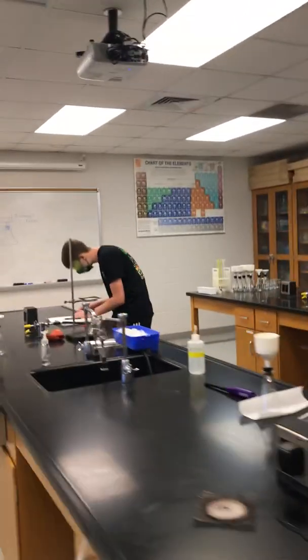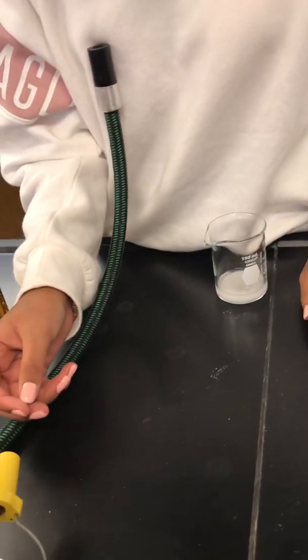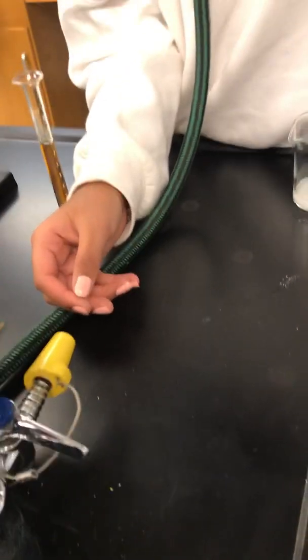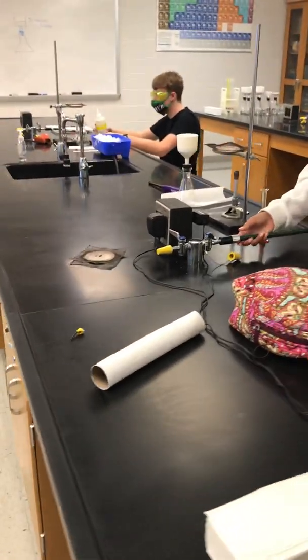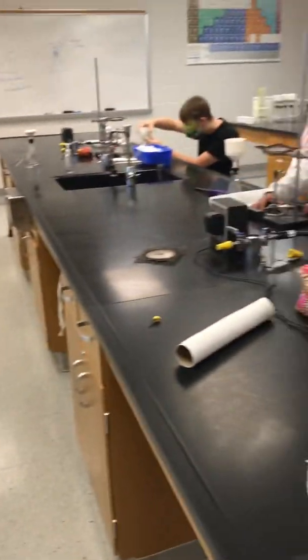All right, we've got to get that off of there. Is it this side? It doesn't matter. Remember how there's an arrow right there — slide that up into the arrow. We don't want the cool water. That just knocks it off. Just don't knock over your 8 milliliters. Adjust everything to accommodate the hose.